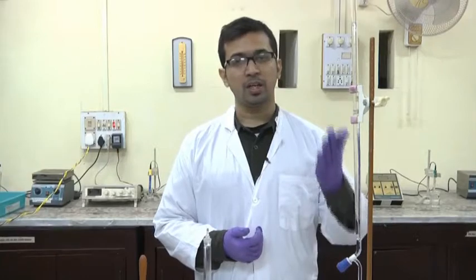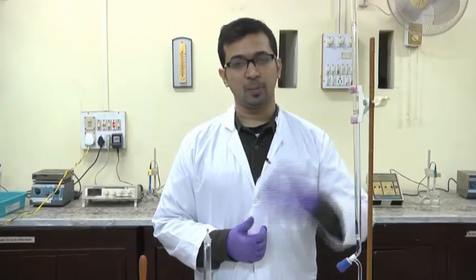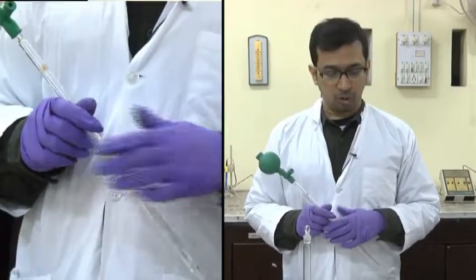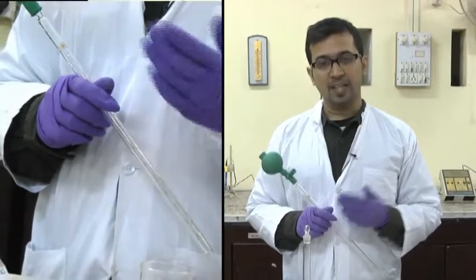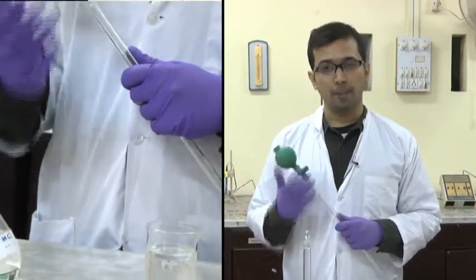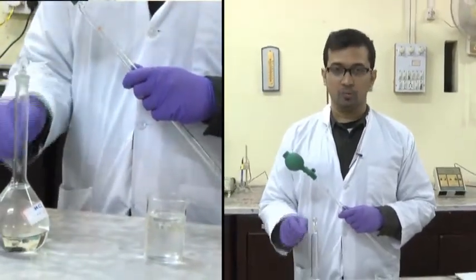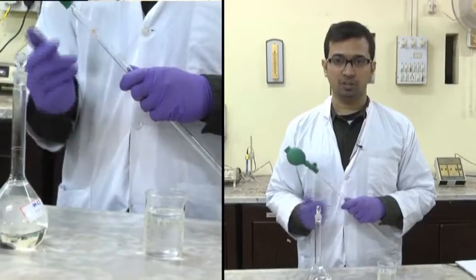We have initially standardized NaOH using the primary standard oxalic acid solution, and using this standardized NaOH we have measured the concentration of HCl. Now we will go for the titration of lysine and glutamic acid. We have taken lysine solution in a 100 ml beaker and will be adding HCl to it. As we have seen in the case of glycine, we have to first completely protonate the amino acid. For lysine, we will protonate it using the HCl we standardized just a few minutes ago — its concentration is approximately 0.832 normal.